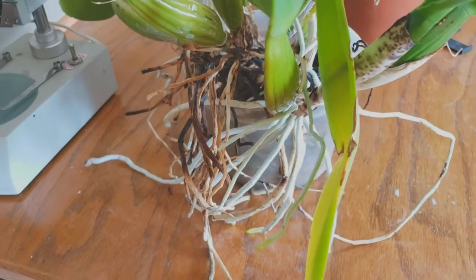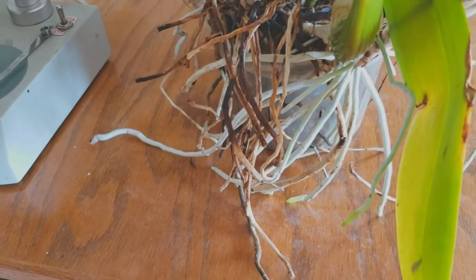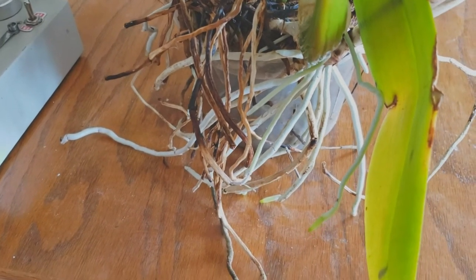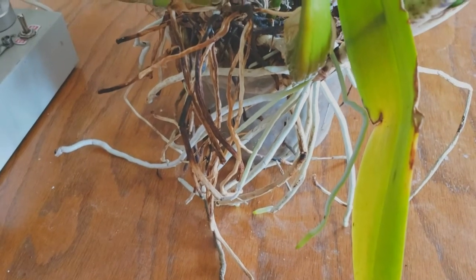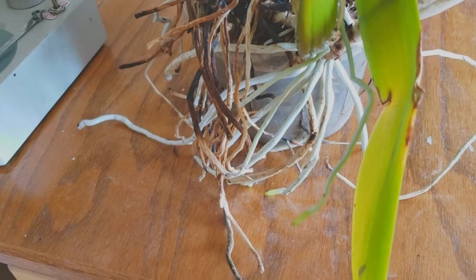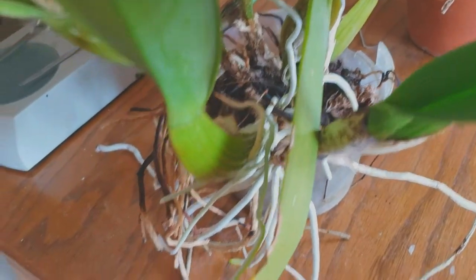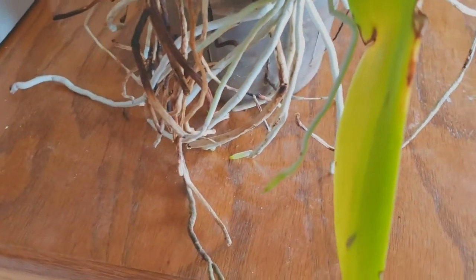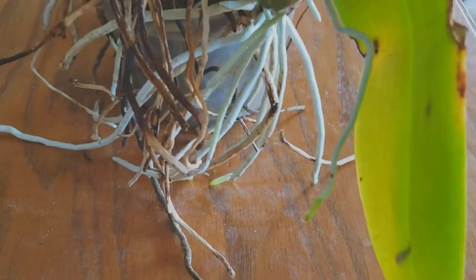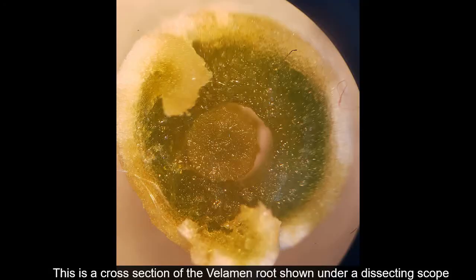Some of them like a drier environment than others, and that actually makes a difference in the root. You can tell if you do a root cross-section, their roots will have, if they're native to a wetter condition, the velamen will be thinner than those that are native to a drier condition. The Cattleyas actually like fairly dry conditions, so they have a really thick velamen layer. So hopefully I'll be able to do a nice cross-section and show that to you guys.